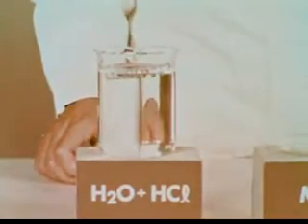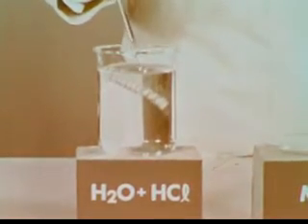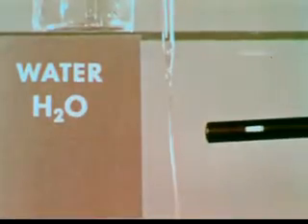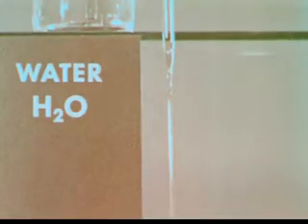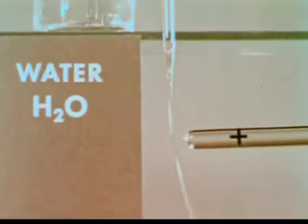Now the ionic solution of HCl in polar water. Well, that's different, all right. A gas forms, a gas which is found to be hydrogen. The hydrated ions in the polar water react rapidly. The unionized molecules in the nonpolar benzene do not. Ions hydrate in polar water for the same reason that water is attracted by a charged rod, regardless of whether it is negative or positive. Polar molecules can align either way.